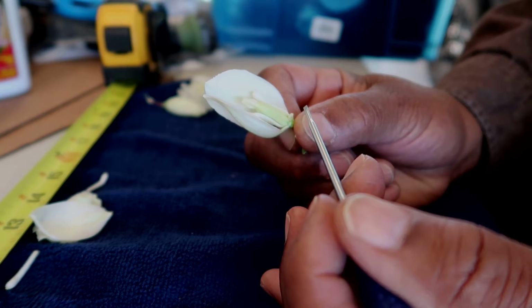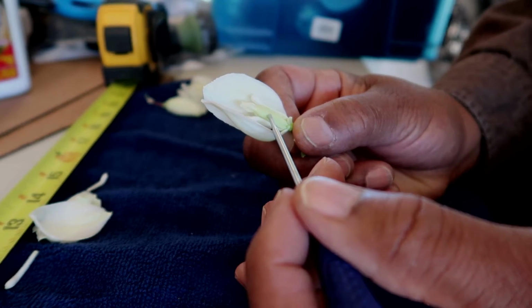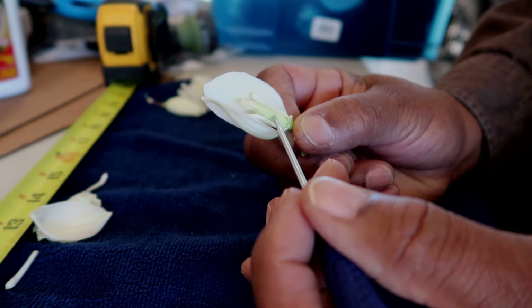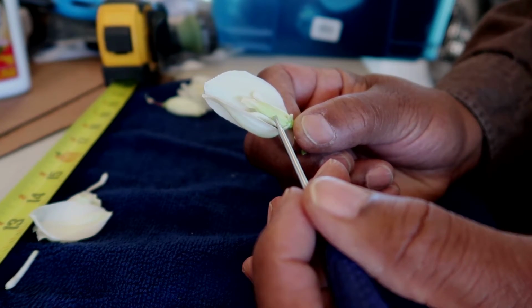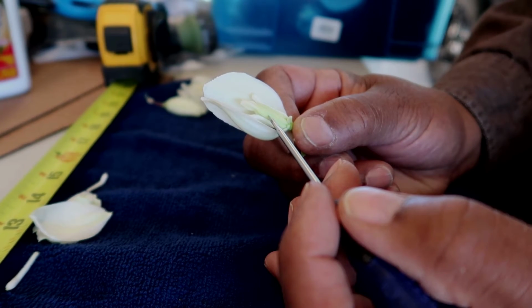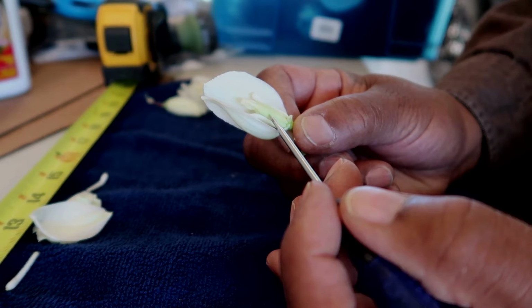The ovipositor drills a hole through here, at which point an internal organ or ovum tube passes through the opening, and the eggs are injected here.